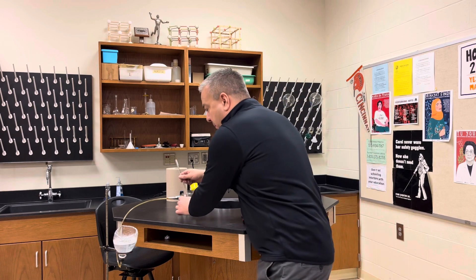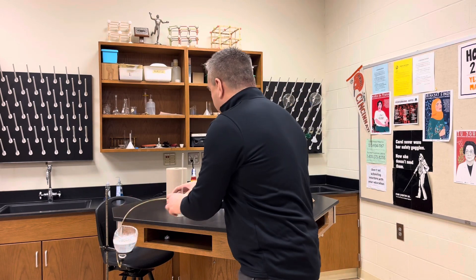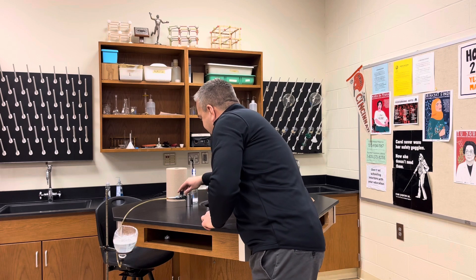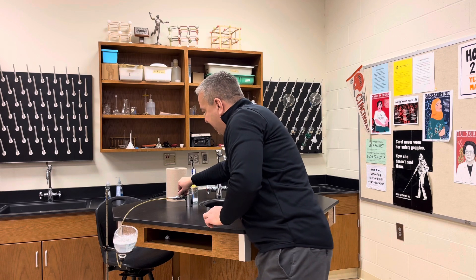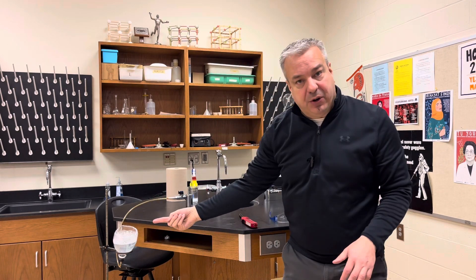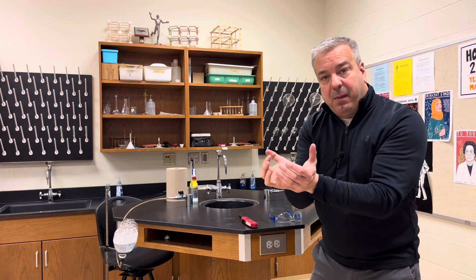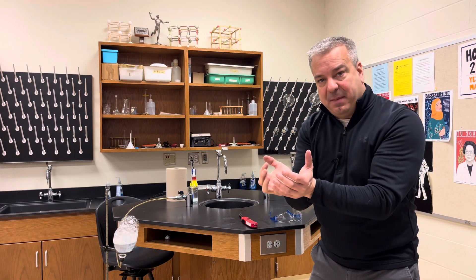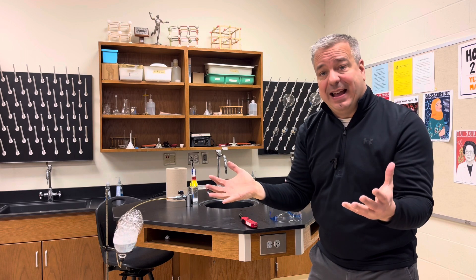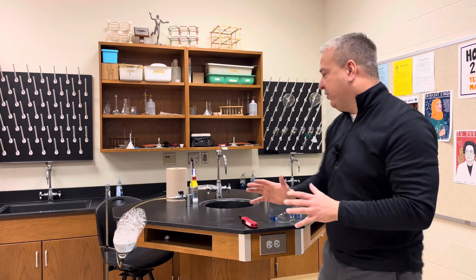Let's go ahead and put some more soapy water in there. We're going to turn on the gas jets, and that gas is going to be pushed through the soapy water so the bubbles are holding the methane gas. What I'm going to do is light that on fire — it's a great demonstration.